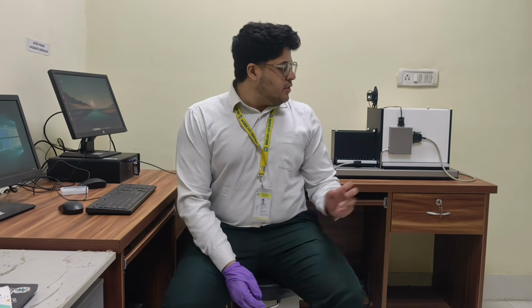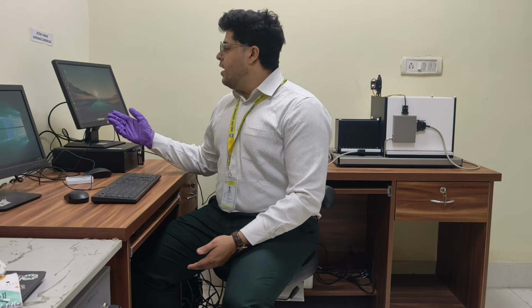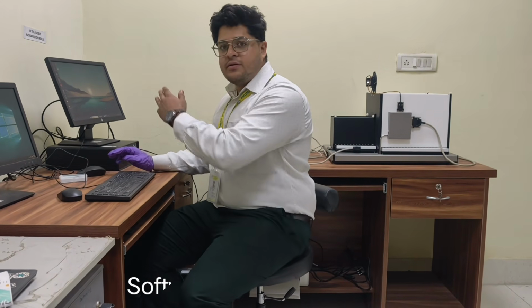Now that we have seen the components of passive avoidance and we have had a look at which types of animals we are going to use, let's have a look at the software and what its components are. We are going to select the trial, design the trial, then place the animal in the light environment, and then start our experiment.